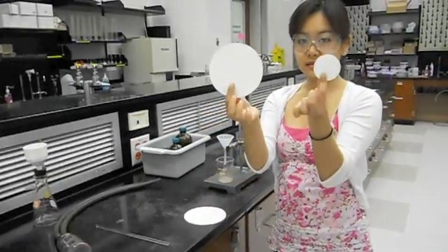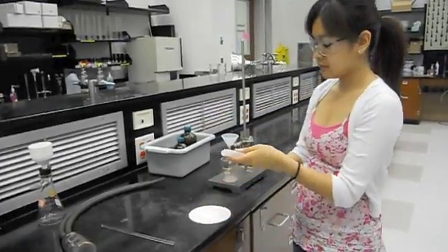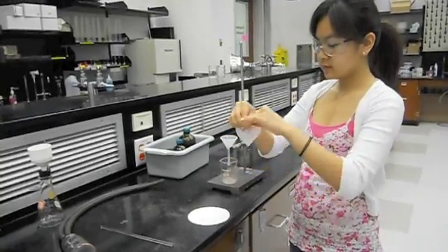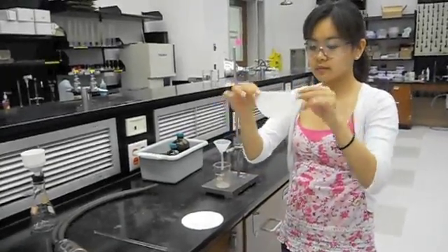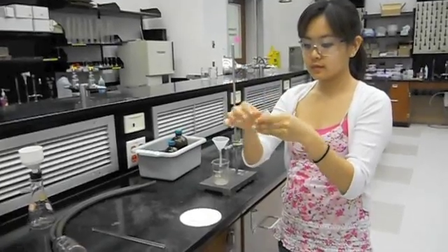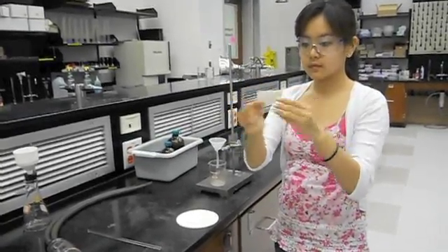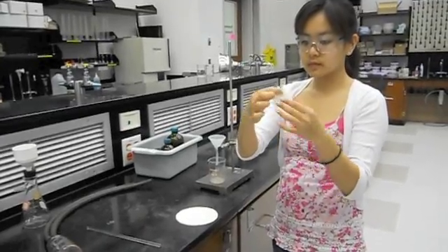Using the larger filter paper, fold it in half, then in half again, open it up and place it in the funnel.